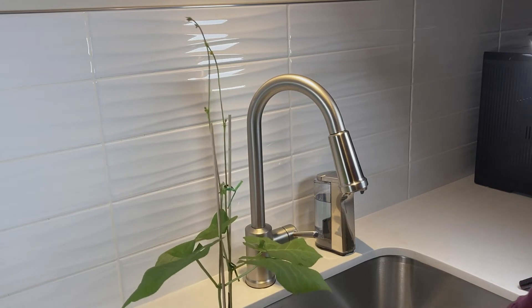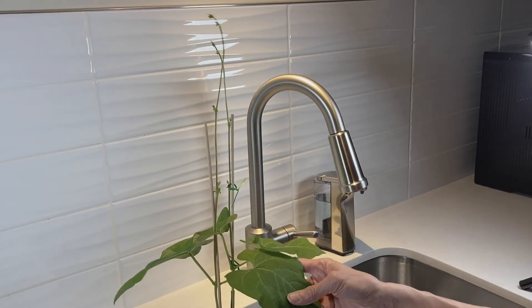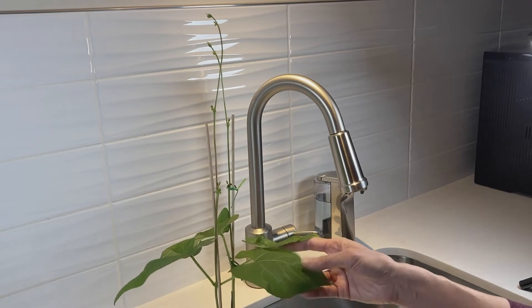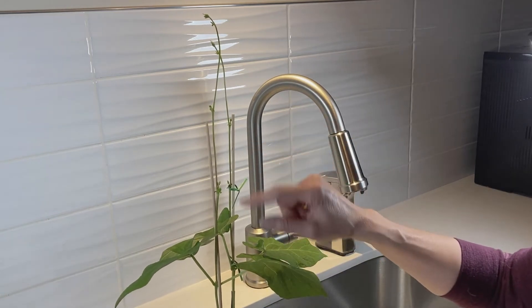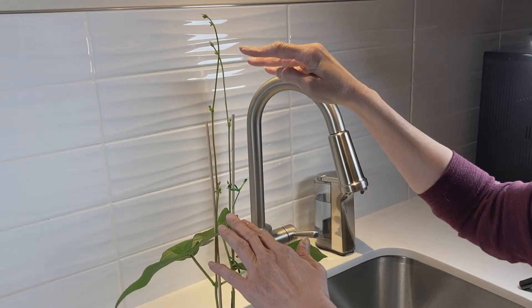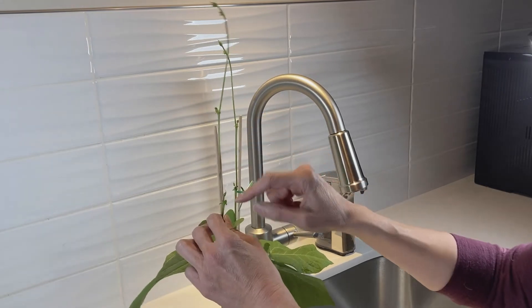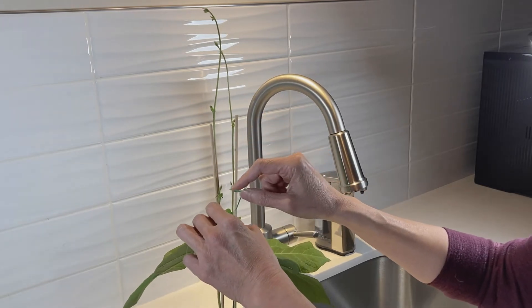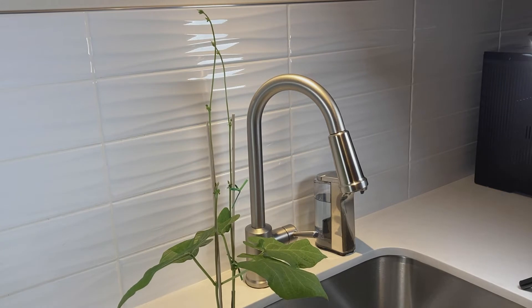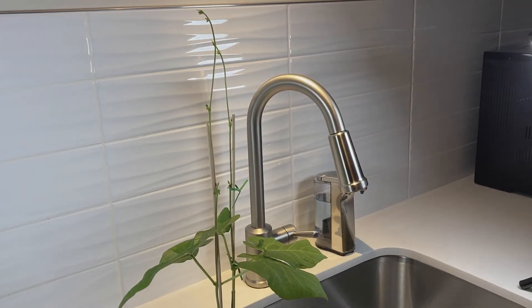So that's treatment C. Make sure you do your color measurements every two days or three times a week for a period of two weeks. You should also be removing any little branchlets that grow after this. You can see there's a little bud here starting up — remove those as well. All these little branchlets that will be starting, remove them as they show up.